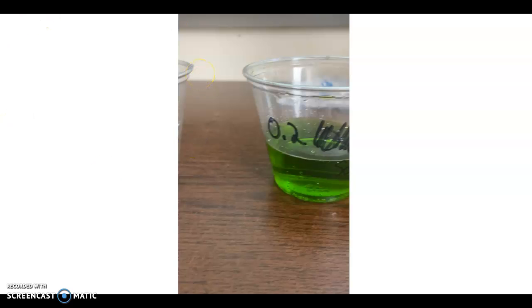I would pause the video here and write down your hypothesis using that if-then format and those vocabulary terms of hypertonic, hypotonic, if water is going to exit the dialysis bag or enter the dialysis bag. You can also use the terms gaining mass or losing mass, because that's how we are going to collect our data. So I would, again, pause here, write your hypothesis.